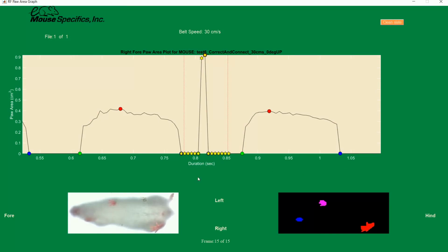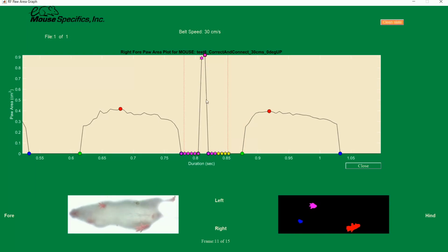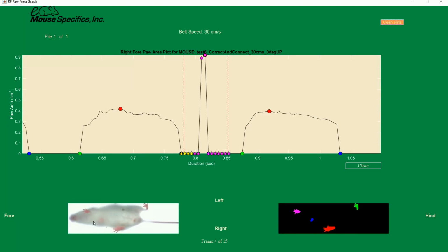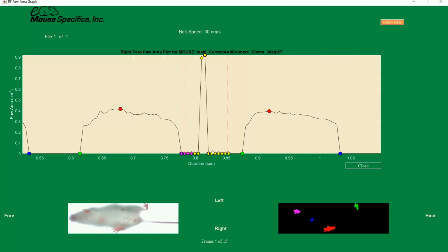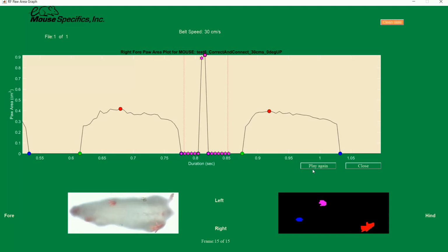When we play back the video, let's pay attention to the right forepaw specifically. On the graph, the software has identified that the animal's paw stepped down into the stance phase around the 0.8 second mark. When we watch the raw video playback, we can see that the right forepaw remained in the air and didn't step down during this time period, meaning that it was actually in the swing phase, not the stance phase. The software generated a type of noise that we will call a false peak. For a false peak, we will want to edit this and change the graph from the stance phase back to the swing phase that we saw in the raw video.